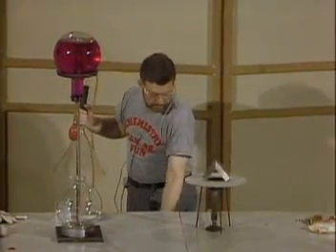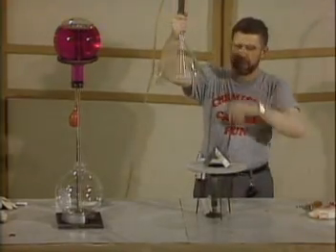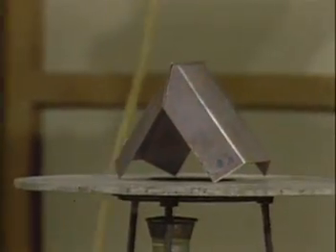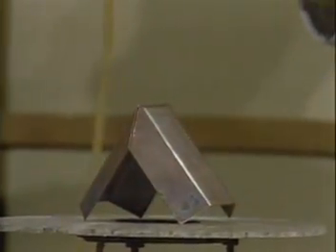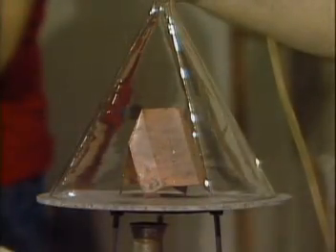Okay Fred. I'm off now. Watch — here's hydrogen flowing through, and we put the hydrogen and you get copper. You lift it up, you get copper oxide. You have copper, copper oxide. As long as it's hot and you have this source of hydrogen, you can carry out this oxidation-reduction reaction. There's copper and there's copper oxide.